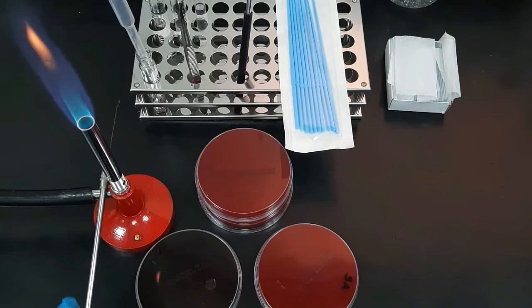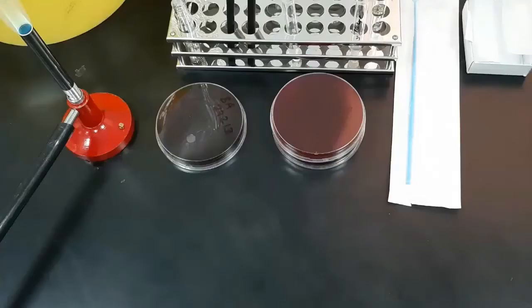Finally, sterilize the wire loop and keep the plate in the incubator for overnight in an inverted position.